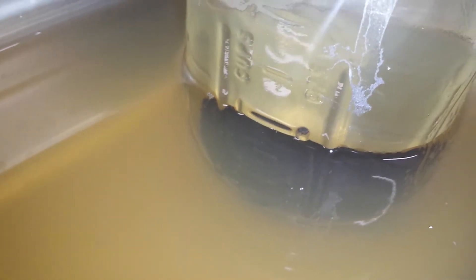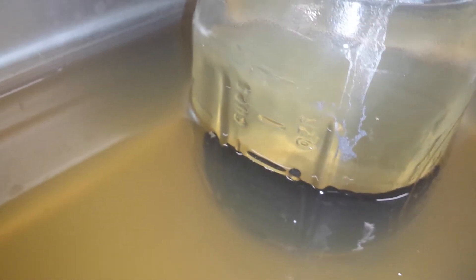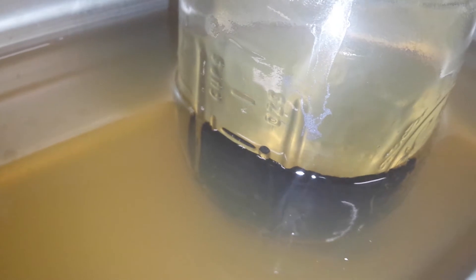Have a look at this — there's bubbles formed too. I don't know where they're coming from; anyone who's got an idea feel free to comment. This is a 100-watt sonicator, and when I hit the power you probably won't hear a damn thing over the noise of it. Have a look at the swirling and the trapped bubbles that come from the bottom.